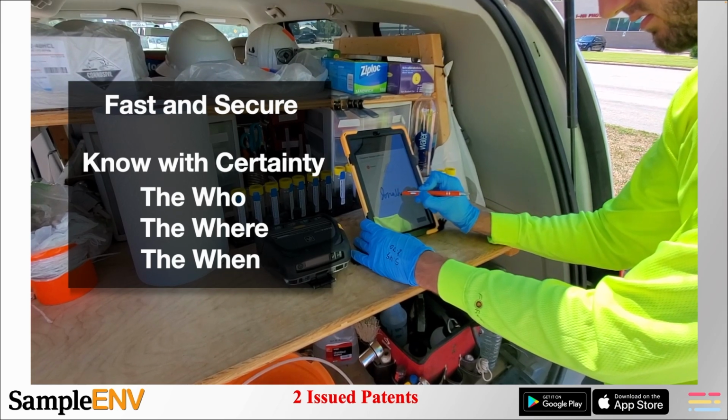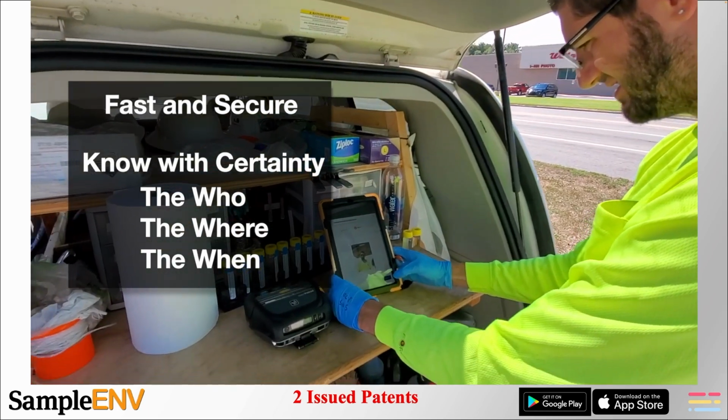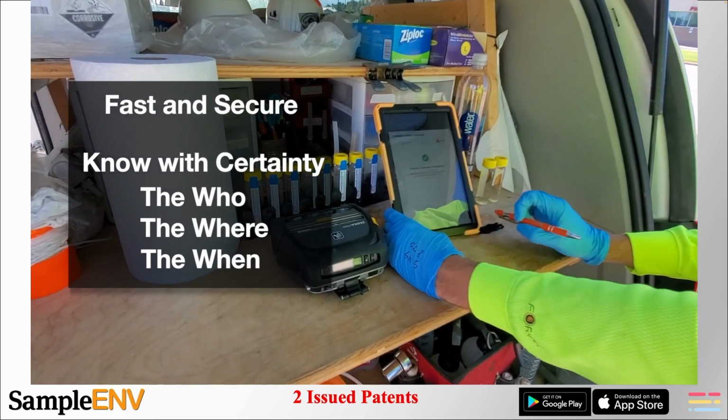You can see here Jonathan is collecting a sample. He's already logged in under his username and password. He's signed his name and he's taken the selfie. So we know it's him. Then he's going to hit the submit button and it's going to print his labels for him.